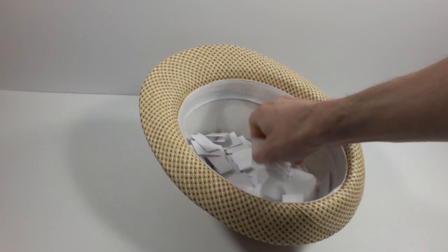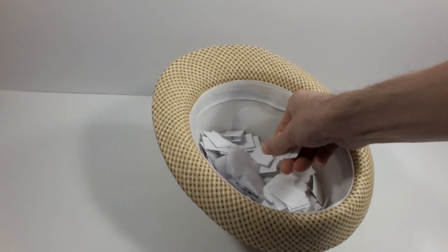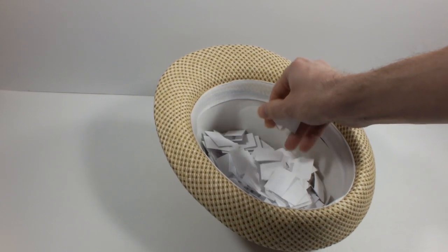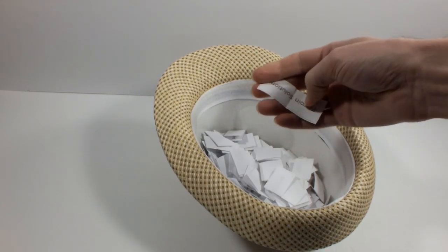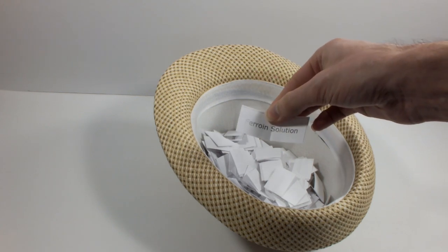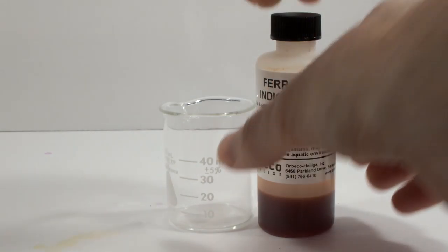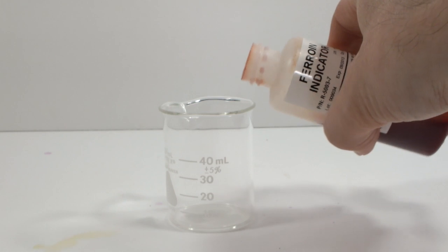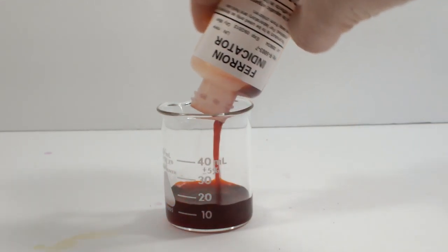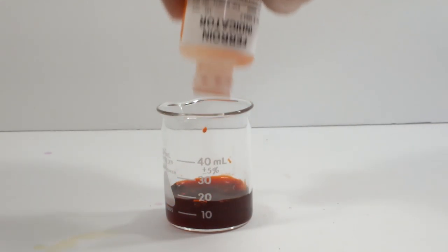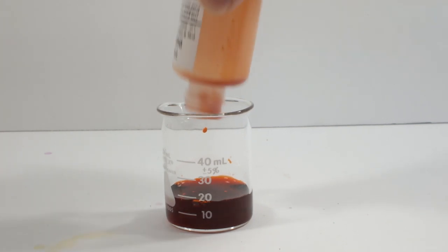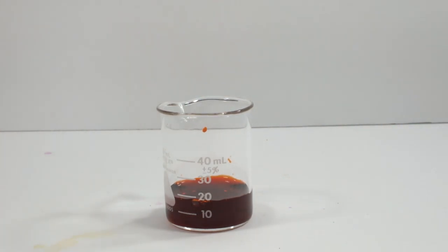What you're seeing now is the very first selection made from the hat when I filmed that last video. It was ferroin, but most of that got used up in the first series of videos on oscillating reactions. So what am I going to do with it? Its use in demonstrations is pretty much limited to reactions in the Belousov-Zhabotinsky class, plus there's not a lot left. With less than 20 milliliters, there aren't a lot of options, so why not see what I can learn about this stuff with the last little bit?